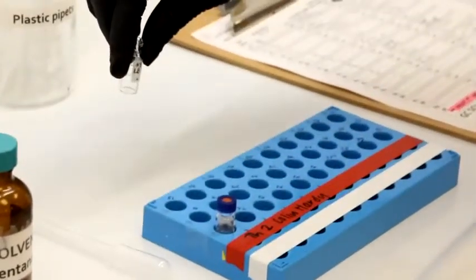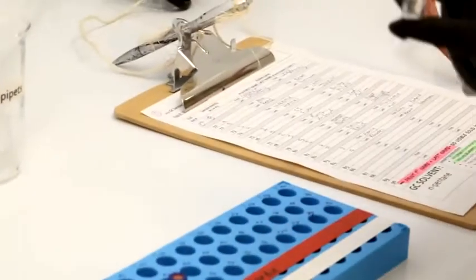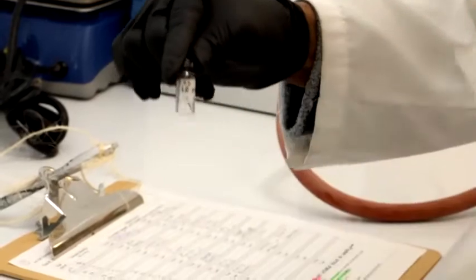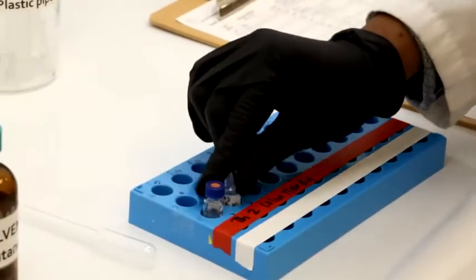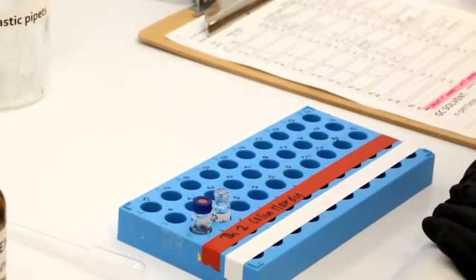For sample or fraction number 5, you'll do the same. Have the name, the time frame, your initials, your TA initials, fill out your teammates' initials, and put it in the correct slot. And this will be processed, and you will be receiving your GC analysis via Canvas.